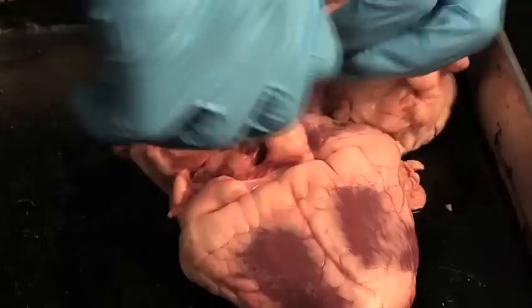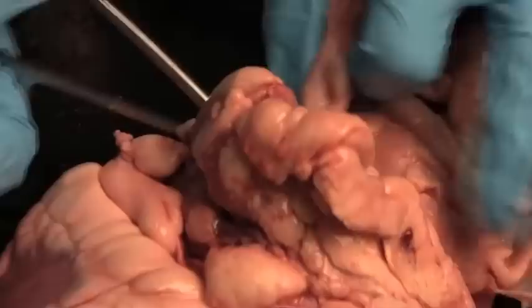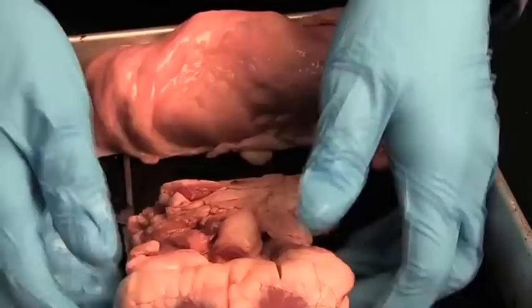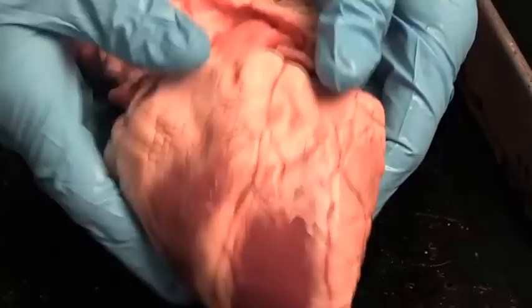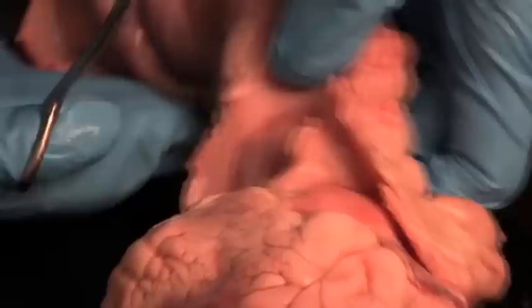It's nice and slippery, but we're going to have to cut this off, right about this area here. See it's coming off here — there's the pericardium. Again, this is the smooth parietal pericardium, and over here is the smooth visceral pericardium. We'll put this to the side, and now we're going to look at the heart itself — at the outside of the heart and the plumbing of the heart.